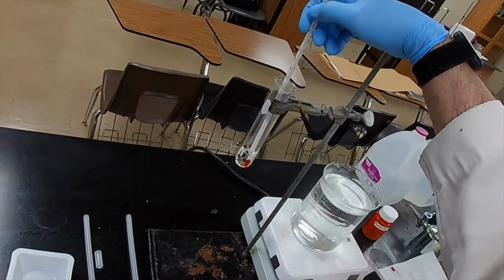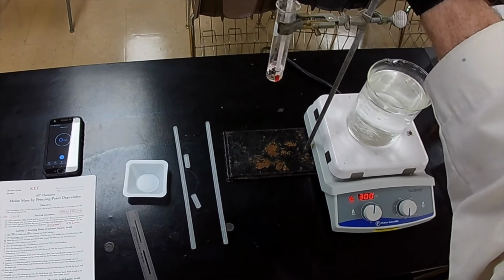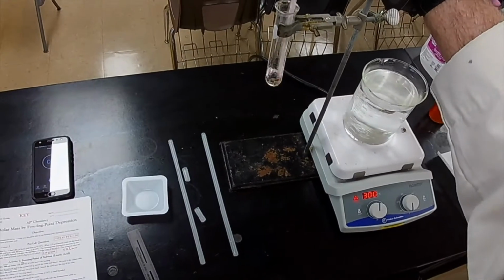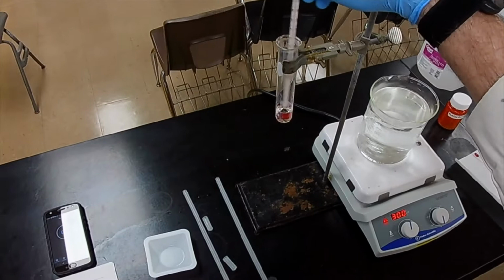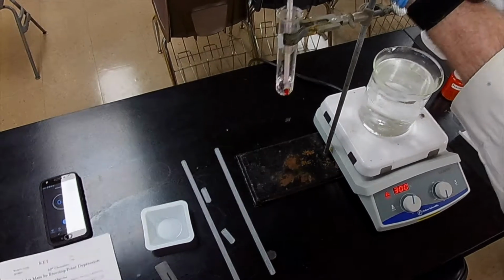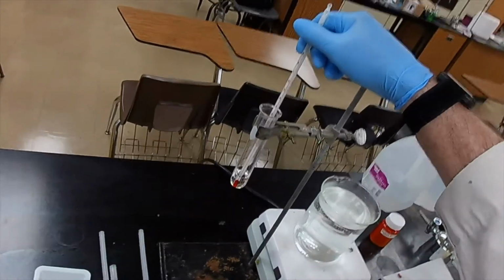How we doing? 68. All right, we're getting there. Now, if I had a lab partner, I'd let my lab partner do the stirring, and I'd do the reading and recording. All right, we have 65 degrees. We're almost there. And the second it hits 60, I'll start the timer. You're probably wondering why I don't write this on a piece of paper right here and just stand here the whole time. Well, personal preference. I'm going to have to put it on the board anyway.